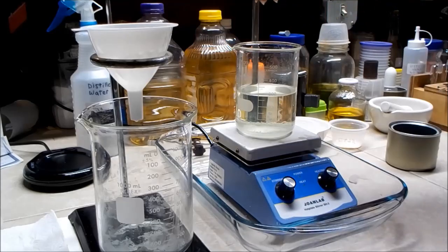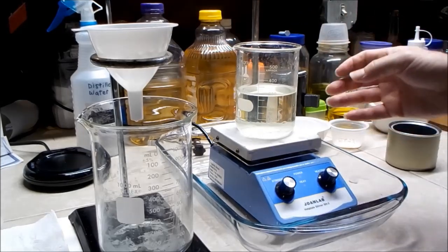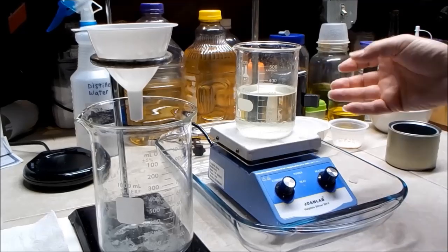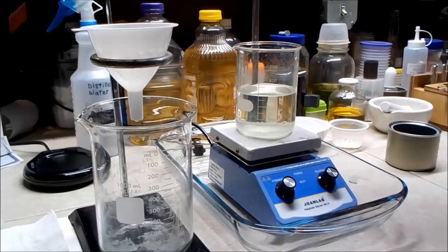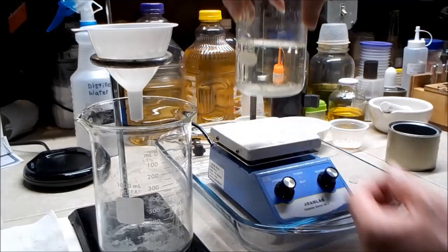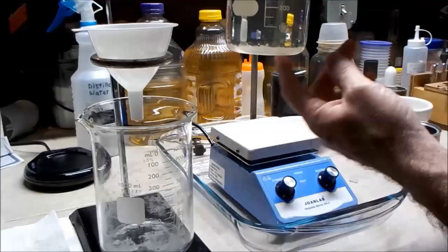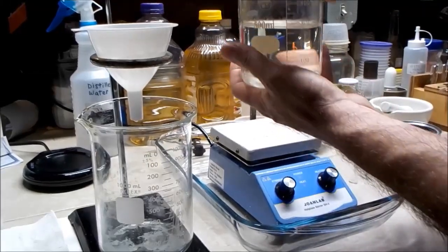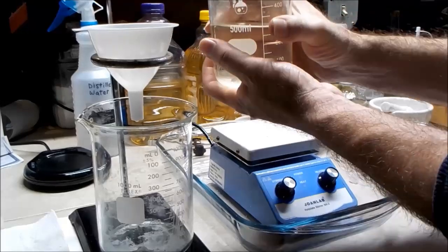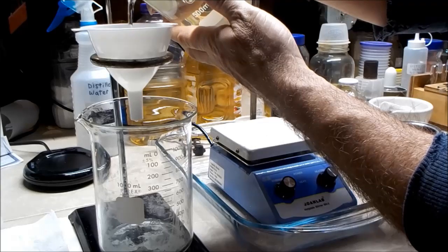I removed some of the water until the solution started to get cloudy, like something was coming out of solution, so I let it cool down and let it set overnight. There are some crystals or crystalline powder in the bottom, so I'm going to try and decant that off and see what it is.